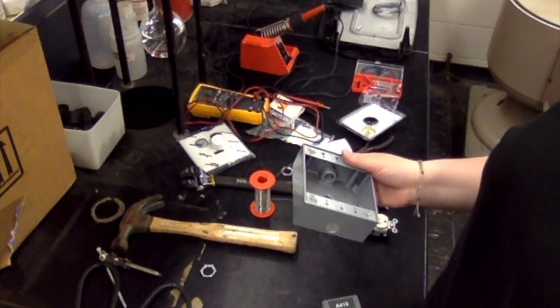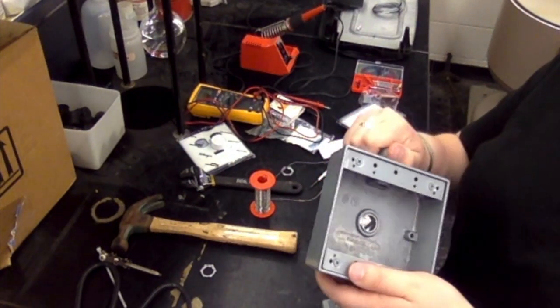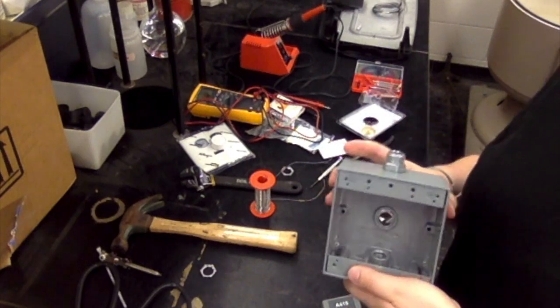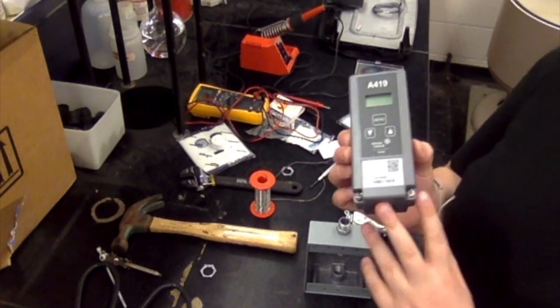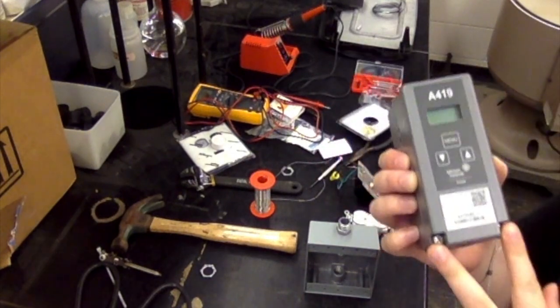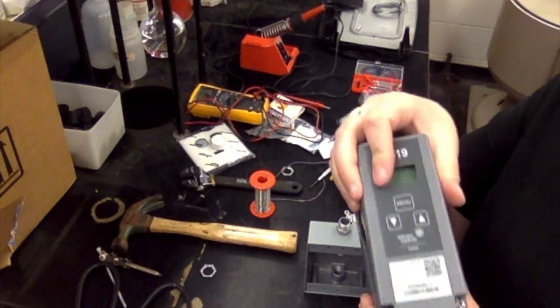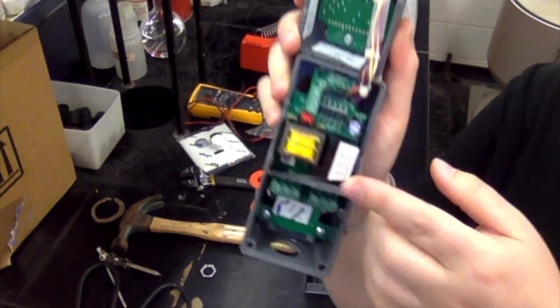To do that, you're going to need a connector, and it's going to go on this top port. So you just screw it in, and then I would take a wrench and tighten that down. You want that to be pretty sturdy. To open this up, there are 2 screws on the bottom. The older ones have 4 screws, I believe, but this is the newer one, so it has 2. Once you remove either the 2 or the 4, it's going to open up, and it looks something like this.